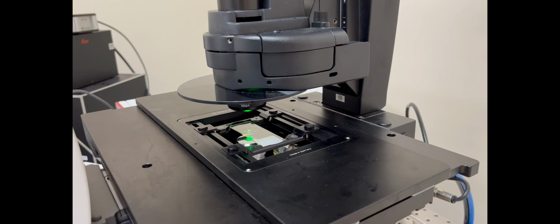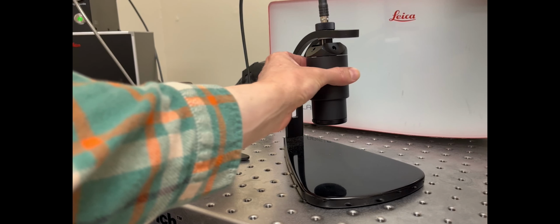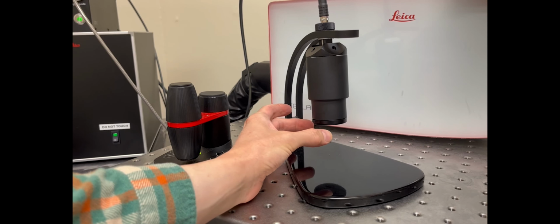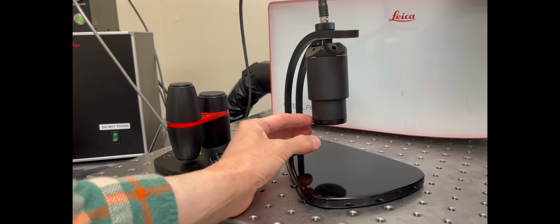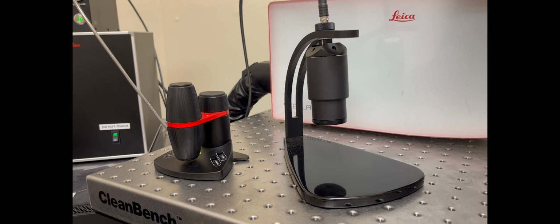And to move the stage around, we use this controller on the left that you can see here. And there's 3 parts to it really. There's a top part that moves it left to right. There's a bottom part that moves it away and then towards you. And then at the bottom, there's actually 2 little knobs in this bottom ring. And what that's for is for changing the stage movement from a coarse to a fine movement. So you turn the knobs, hold them for a second, let them go, and that should switch from coarse to fine.